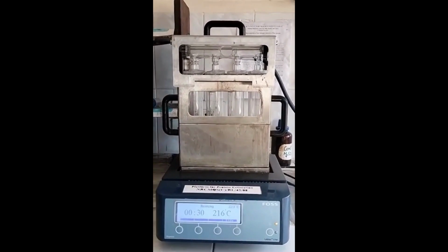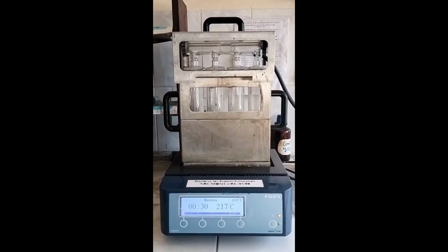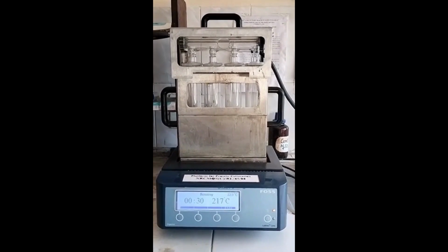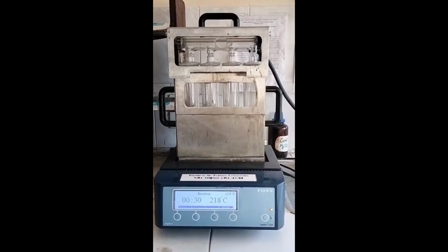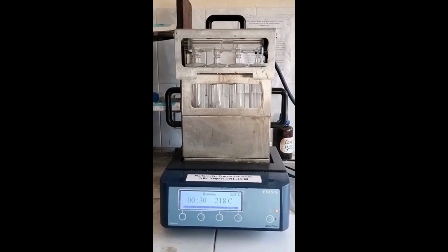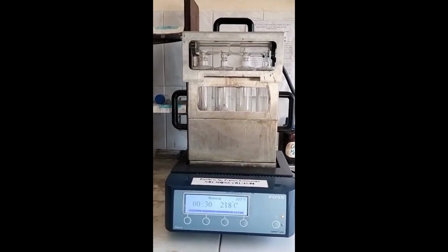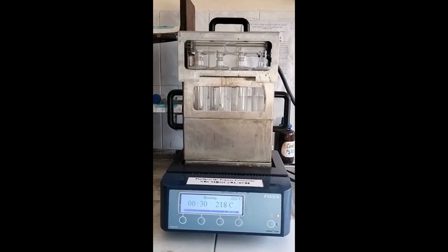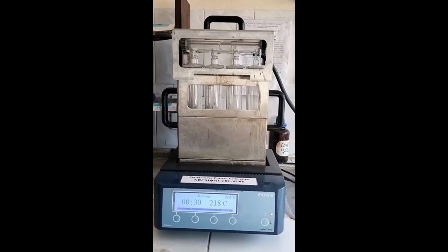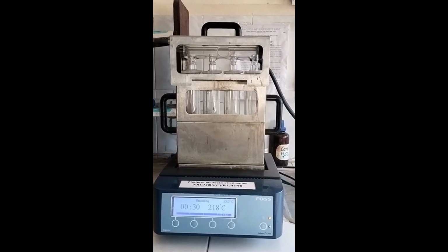Sample is digested using concentrated sulfuric acid in the presence of potassium sulfate and copper sulfate, and at a very high temperature. Temperature goes to 410 to 430 degrees Celsius. So in this way, what is happening is that we are digesting the sample. Whatever carbon is there will be converted to carbon dioxide. Hydrogen will be converted to water vapor. Your sulfur will get converted to sulfur oxide. Your phosphorus will be converted to phosphorus oxide. So all the other elements will get converted to their respective oxides, and your nitrogen will get converted to ammonium sulfate. So during digestion, your nitrogen which is present in the sample is getting converted to the ammonium sulfate.